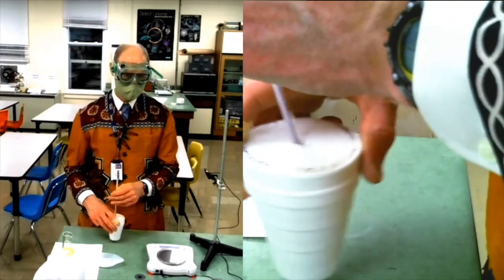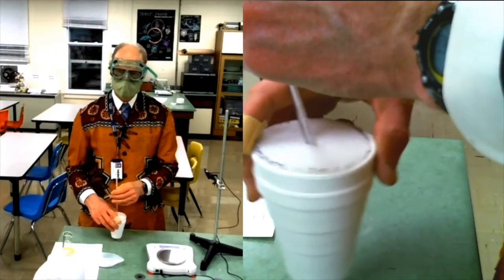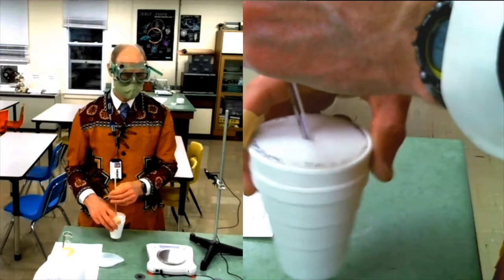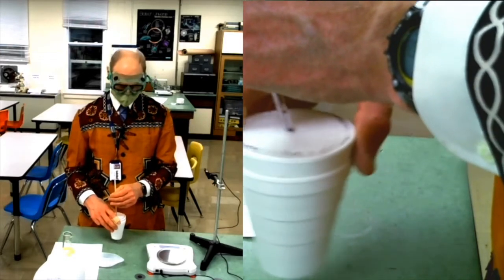The temperature is rising. I'm not hearing the tapping of the salt so much, so it might be dissolved, nearly dissolved.